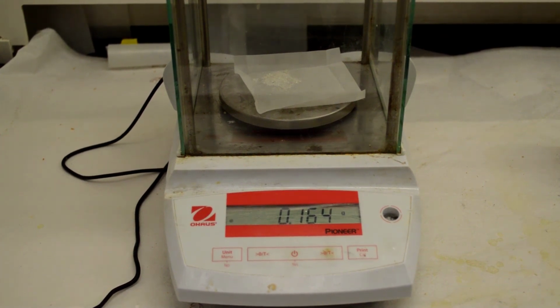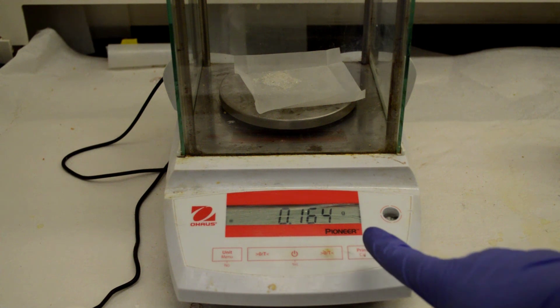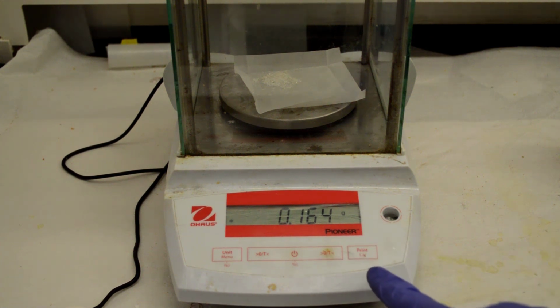Okay, the next thing is to check the purity of acetanilide using melting point. I'm going to do that off the record and post the melting point value on the blackboard. But note down this weight. We got this much acetanilide from the initial 1.55 something grams of impure mixture.